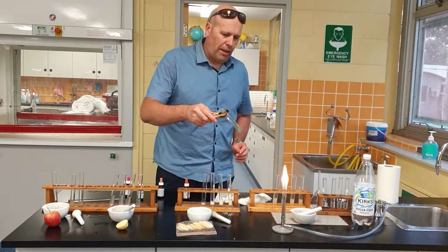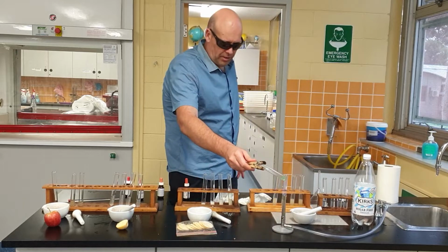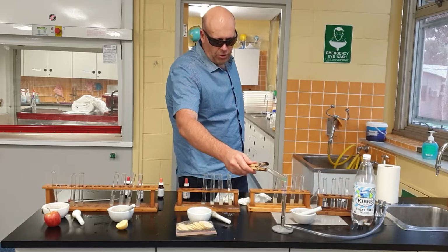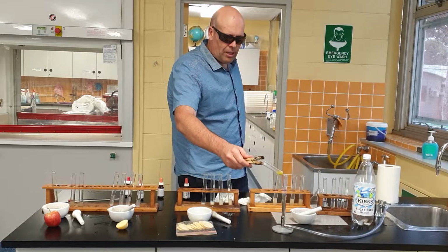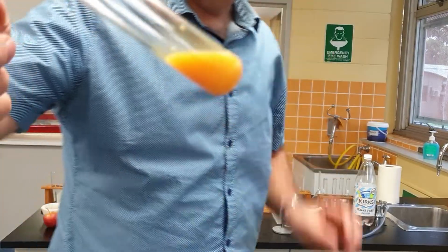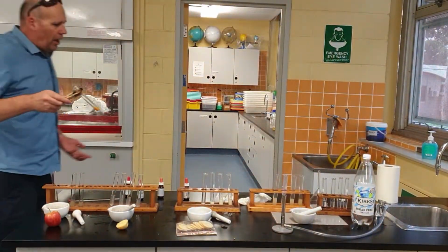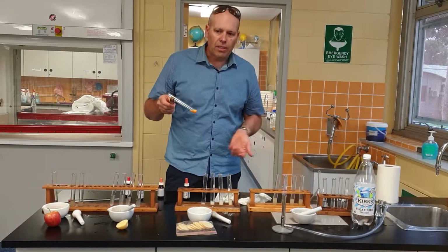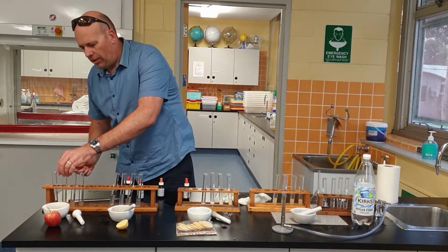All right, well, you've made that prediction. So now let's put it on the heat and let's see whether we can get a reaction happening here. Remember, we're seeing whether glucose, a simple sugar, is in here. Oh, look at that, lovely. We've got a beautiful orange colour. So we've got plenty of sugars. There could be a bit of glucose in there, but there's also fructose. There are many simple sugars in there, but we tested for glucose, and absolutely glucose is in there.